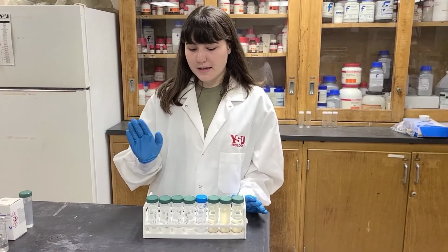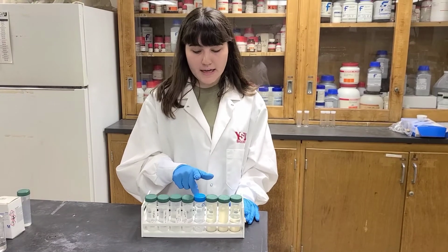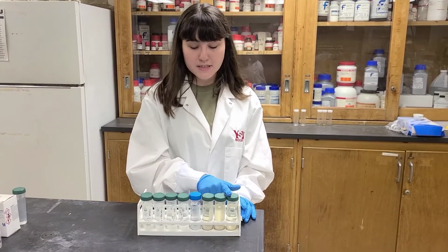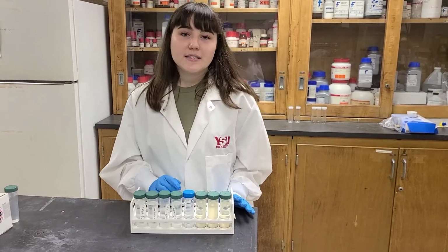Alright, so now we have our 4 standards made, and we also have a blank of milli-Q water in between our standards and our samples, and we have our 3 samples here. So now we are ready to go upstairs and run it on the ICP.